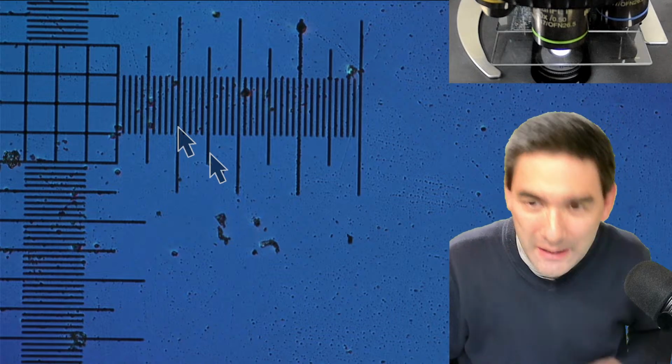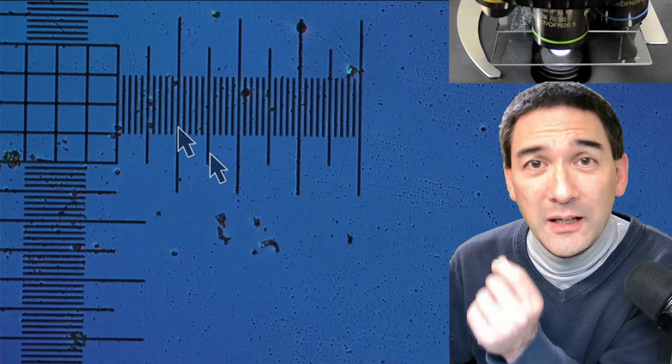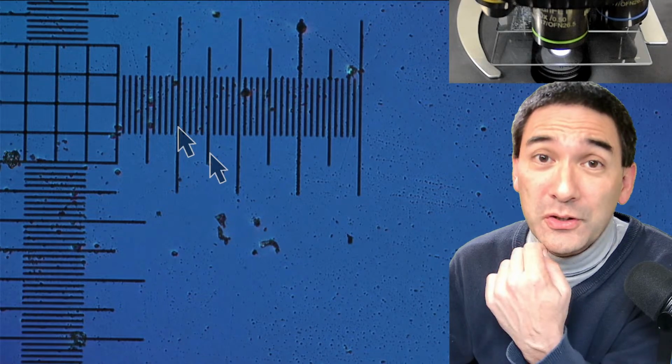So what am I doing today? For somebody who joined in later: today I'm putting some hair under the microscope and measuring how much my beard was growing in one day. It's very quick, huh?